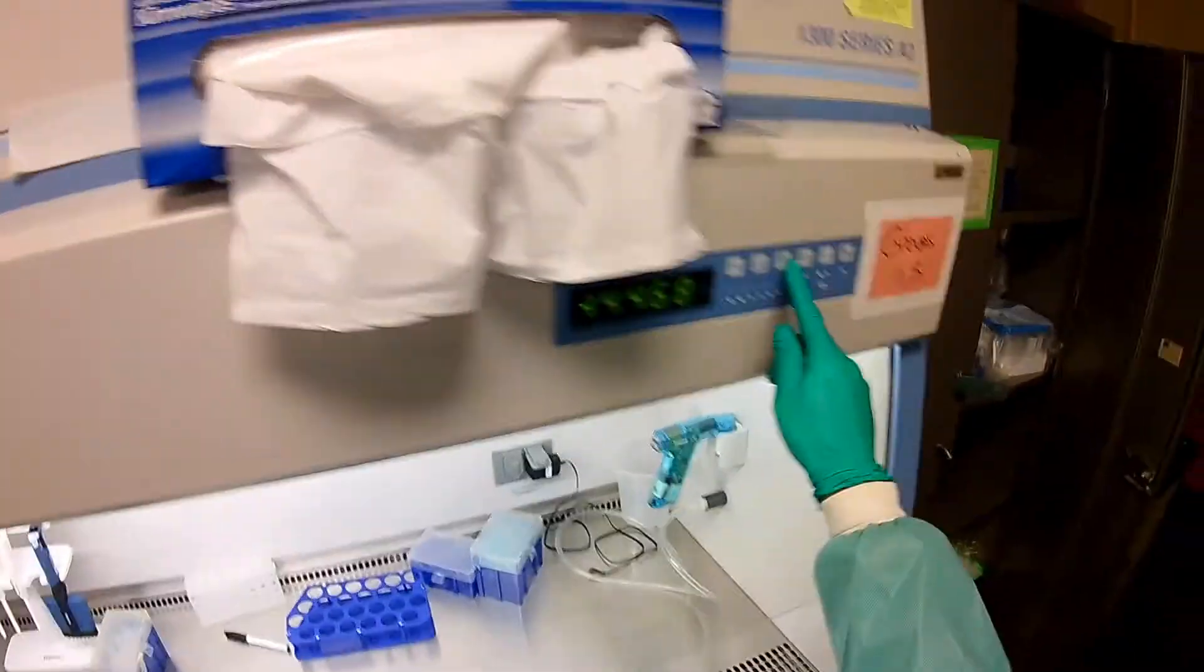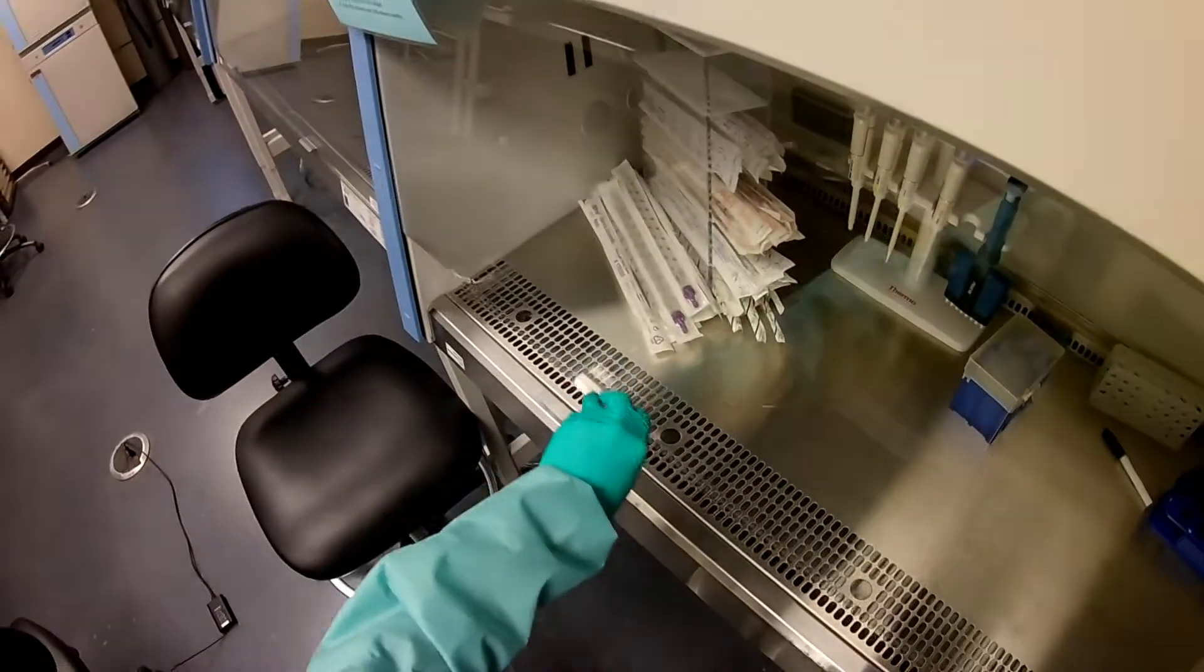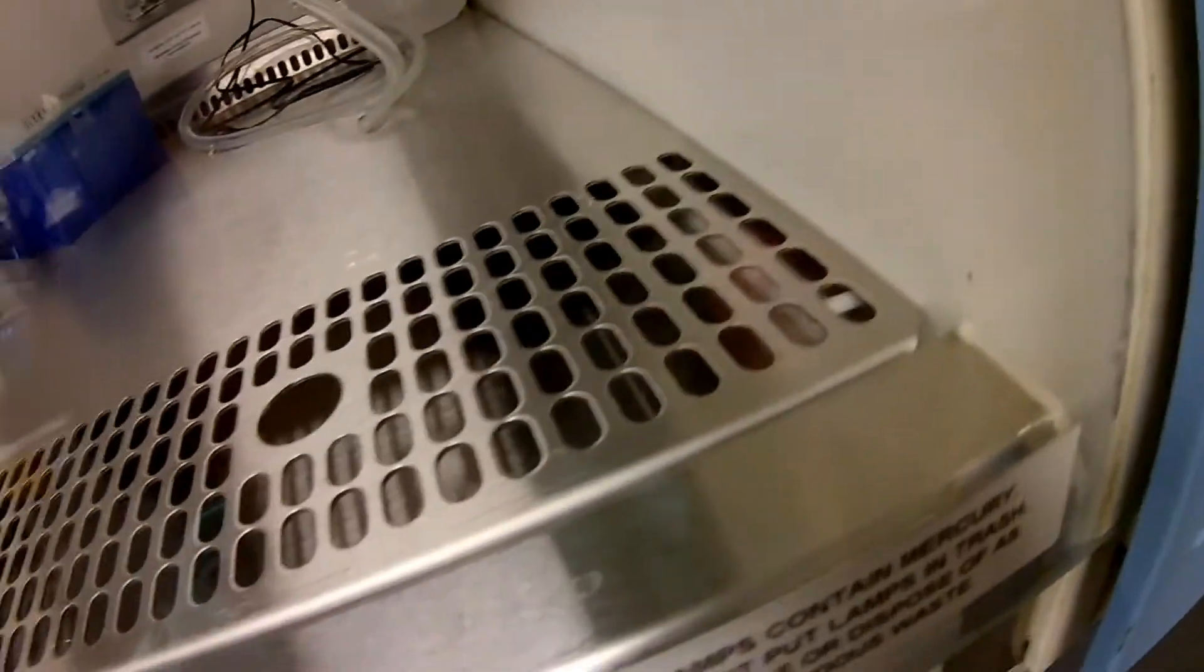I think I'm pretty good on anything else. We're done. We can turn off the light. We can close the biological safety cabinet, and now I need to clean up this aspirator flask.